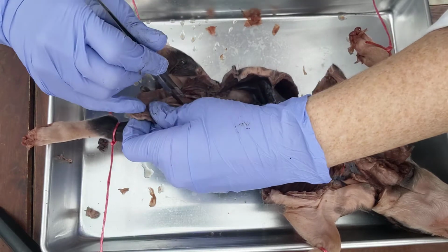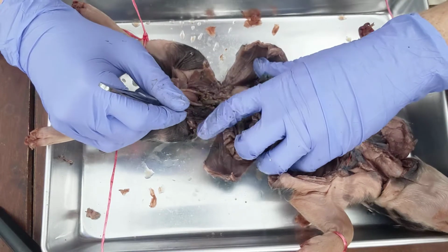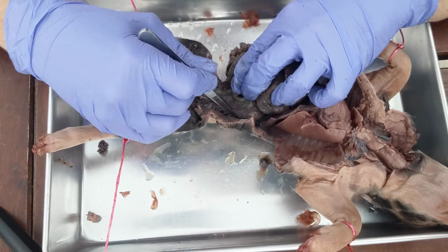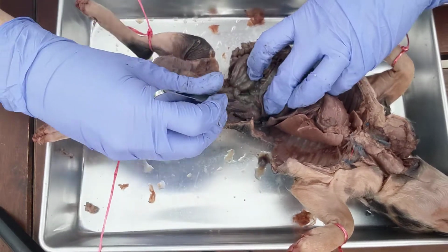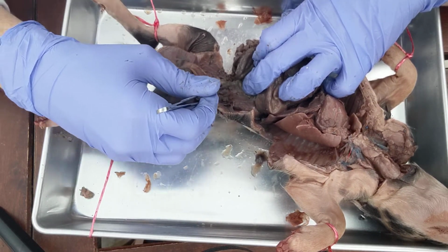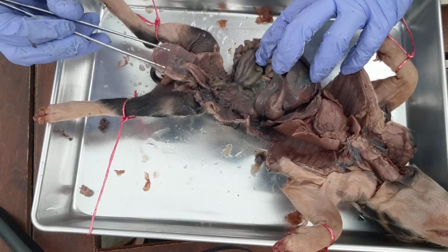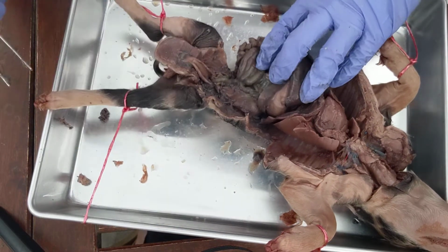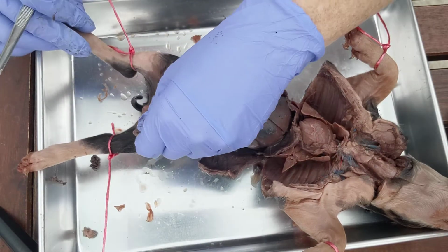So the ureter is going to go into the urinary bladder. And the kidney on the other side, there it is. Okay. And there you go, the ureter as well, right there. So again, I'm not doing any full dissection. I'm just kind of showing you briefly where to find things. There's the kidney back in there. Okay, that's pretty much it.